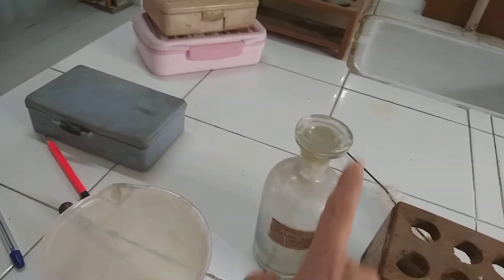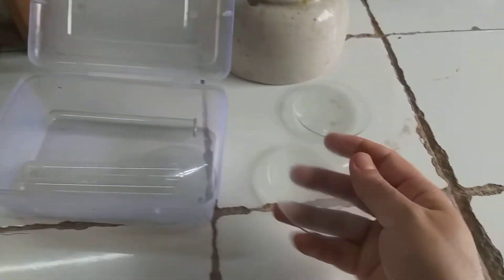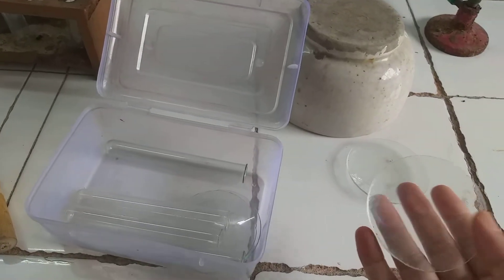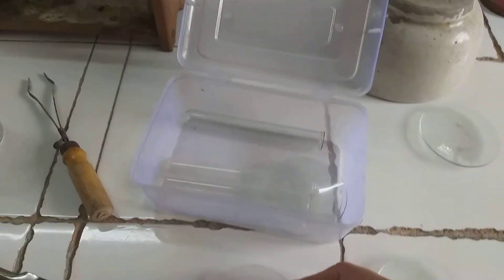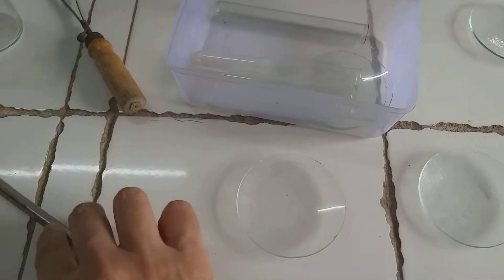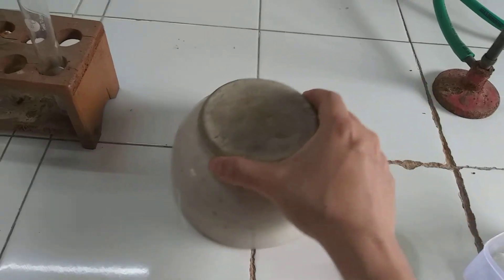These are called watch glasses. They are used for observing various substances. We take out the substance and put it in these watch glasses and observe the substance. This is a watch glass.